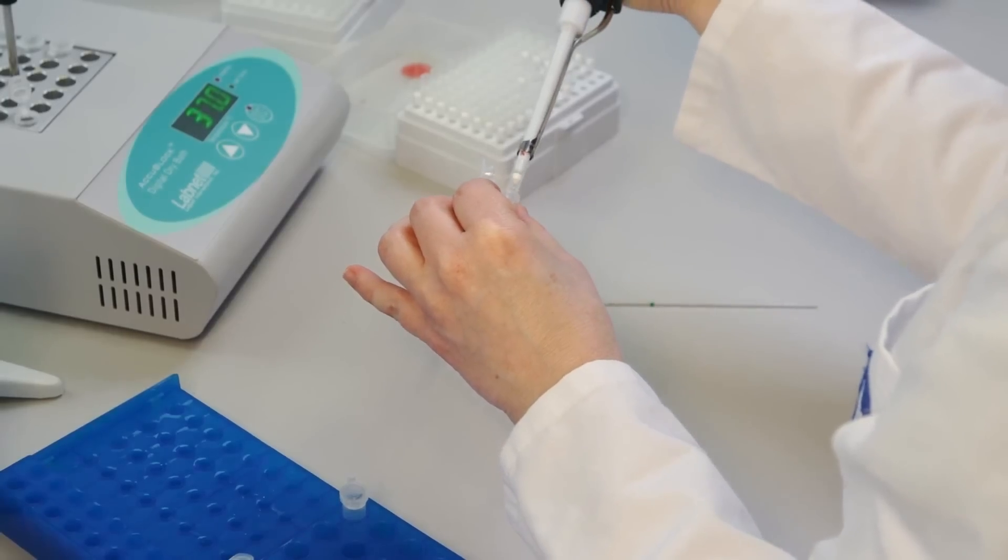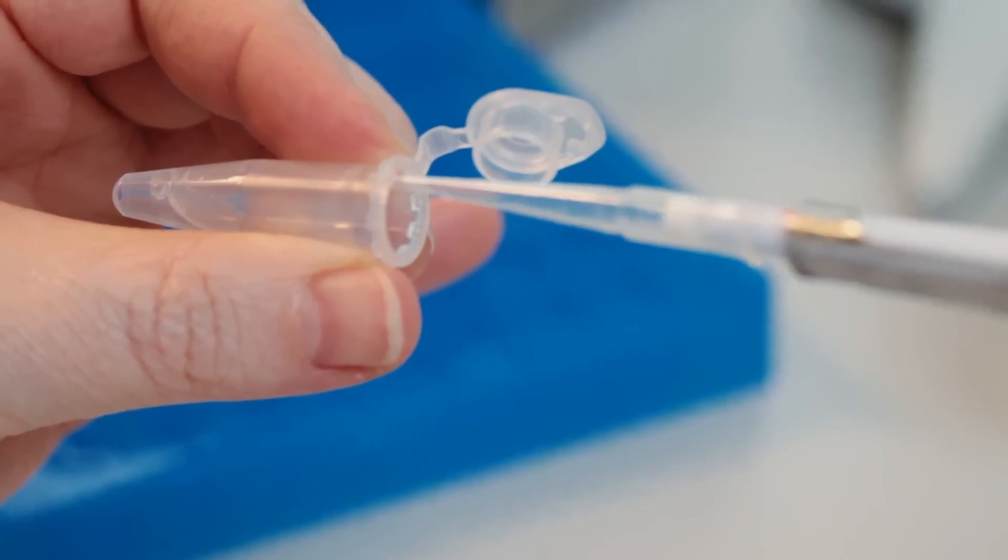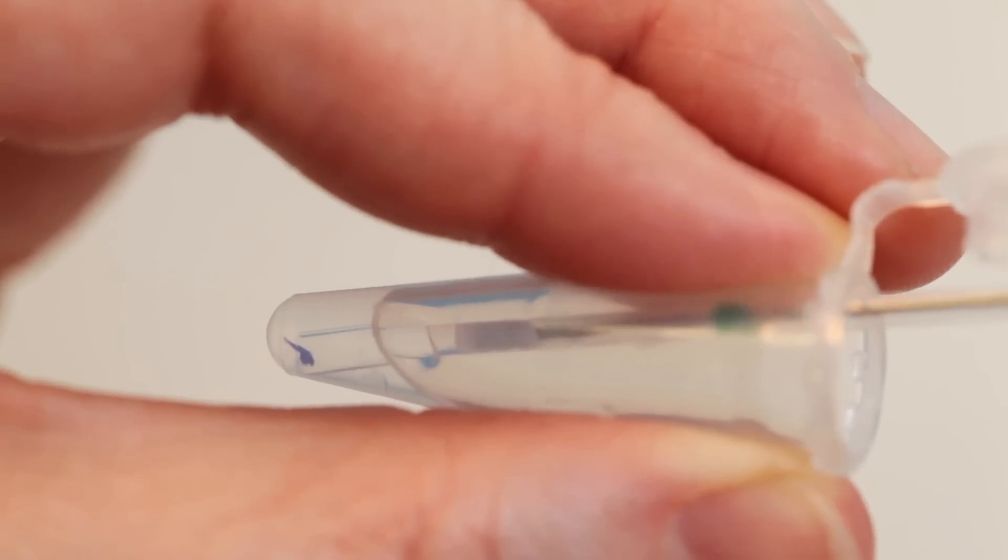Cover your sample with liquid agarose as shown with this stained three-day-old zebrafish embryo and gently draw it into the container.